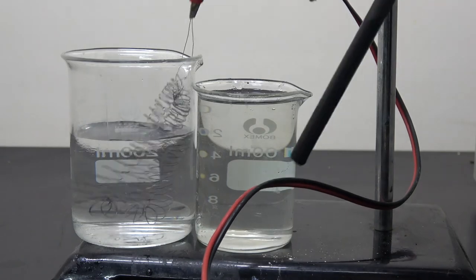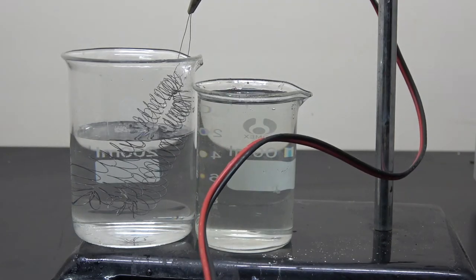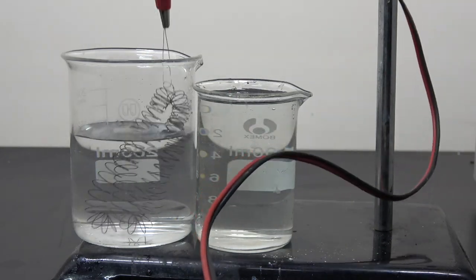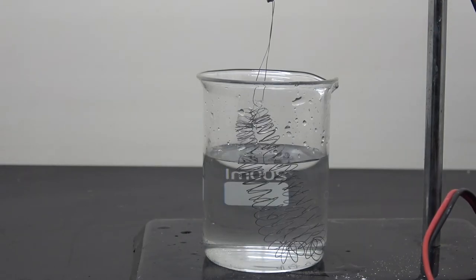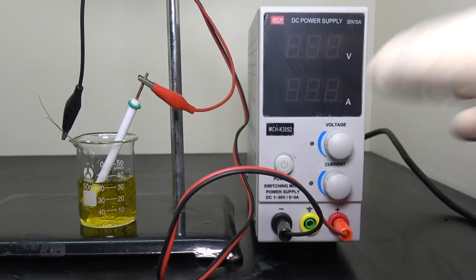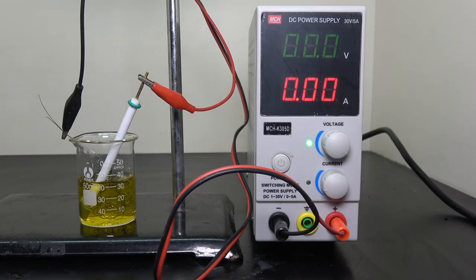At this point, the electrodes should be ready to go. I took them out of the beaker and thoroughly washed them with distilled water. After all those preparations, we finally come to the point to actually plate the platinum.